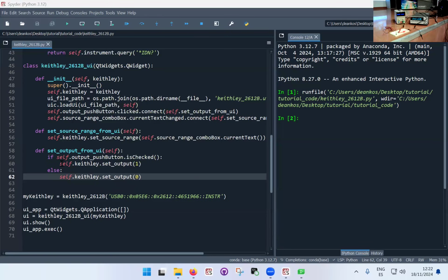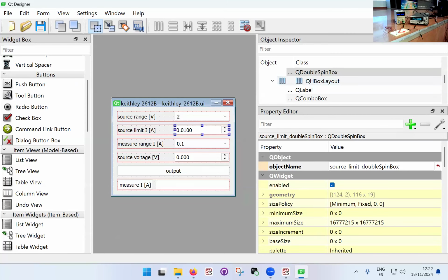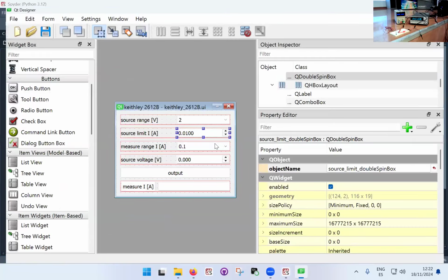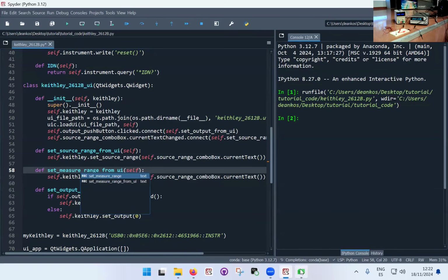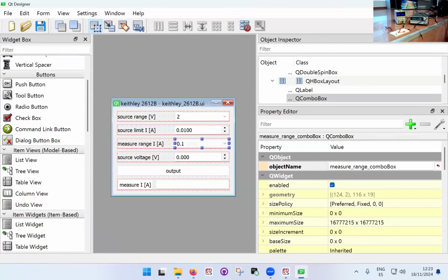All we need to do now is connect the rest of the UI elements. So the source limit, the measure range, the voltage. So for the combo box, we have another combo box, which is this one, the measurement range. And so I can copy paste this below. Just need to be careful to change the names correctly. So set measure, I think it was the measure range, yeah, set measure range from UI. Set measure range, I can use that. Set measure range, self dot measure range combo box. And if you just double check that this is actually what it's called, measure range combo box, that's it.